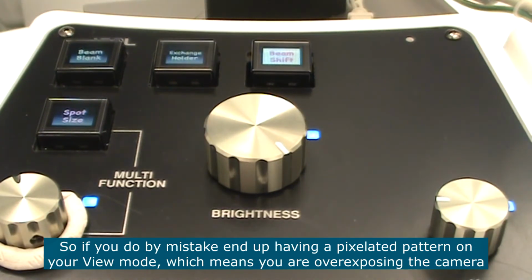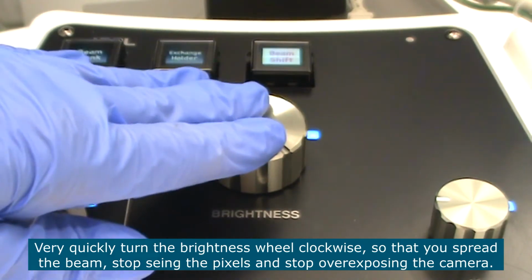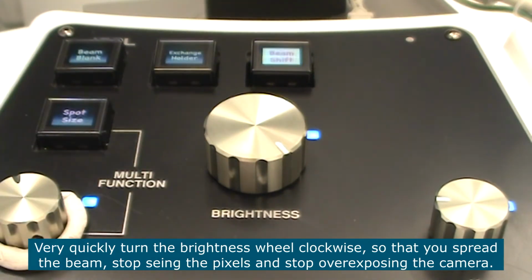So if you do, by mistake, end up having a pixelated pattern on your view mode, which means you're overexposing the camera, very quickly go to the brightness button and turn it clockwise so that you spread the beam and you stop seeing the pixels and you stop overexposing the camera.